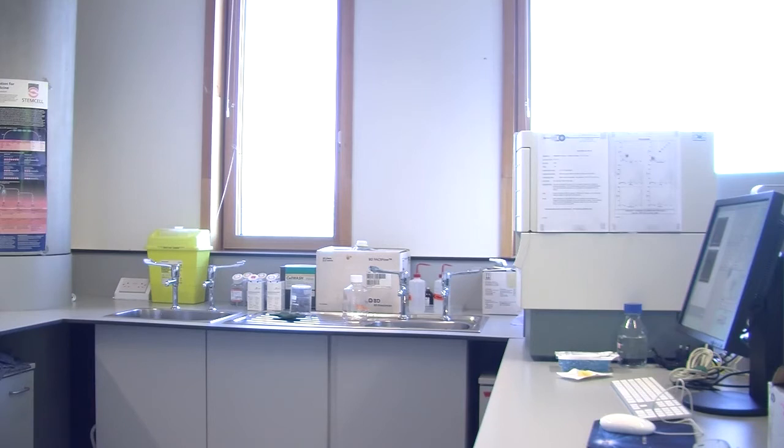Yes. So the problem is cells are sticky. If we added these antibodies to mouse lymphocytes, we would get some binding, or we would get some fluorescence, because cells are just slightly sticky. And if you add an antibody, even if it's not specific, some will just stick to the surface. So cells will be slightly green, slightly red, slightly orange, slightly violet, just because some antibodies stick to the surface.